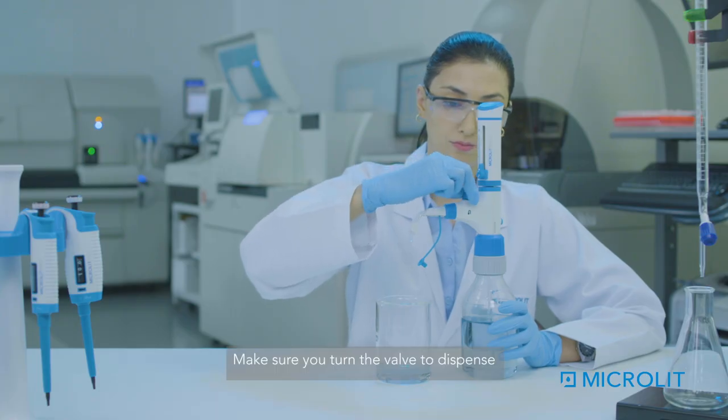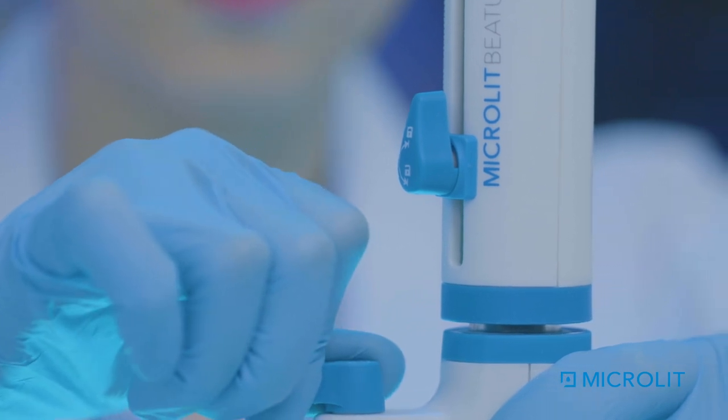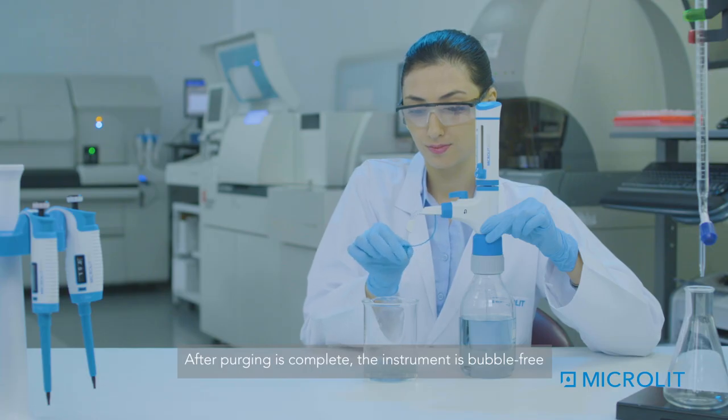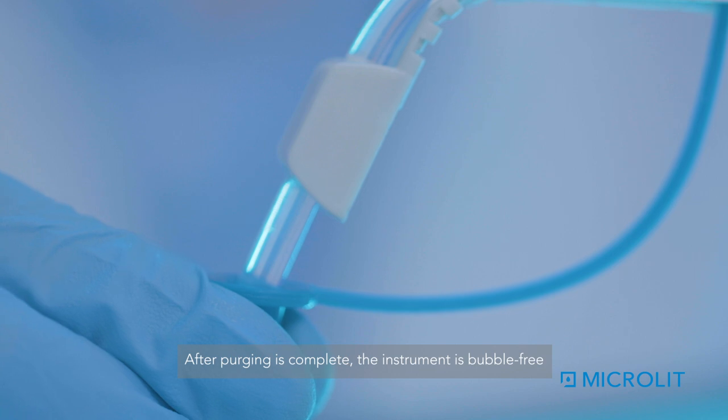Make sure you turn the valve to dispense. After purging is complete, the instrument is bubble free.